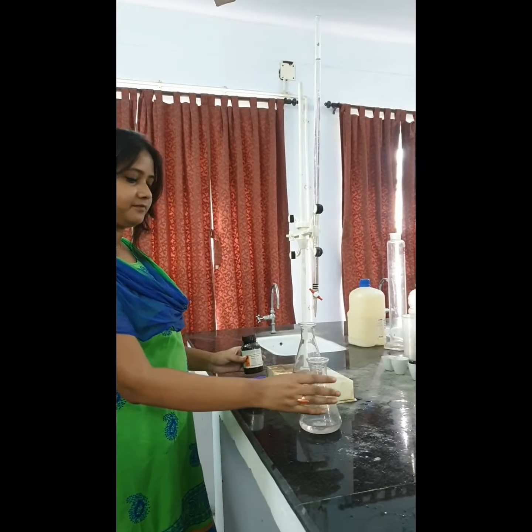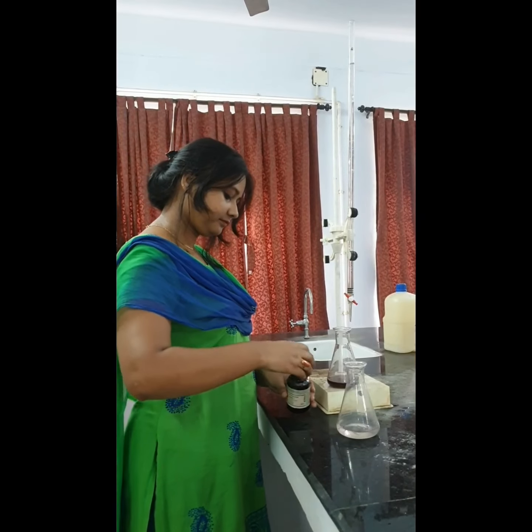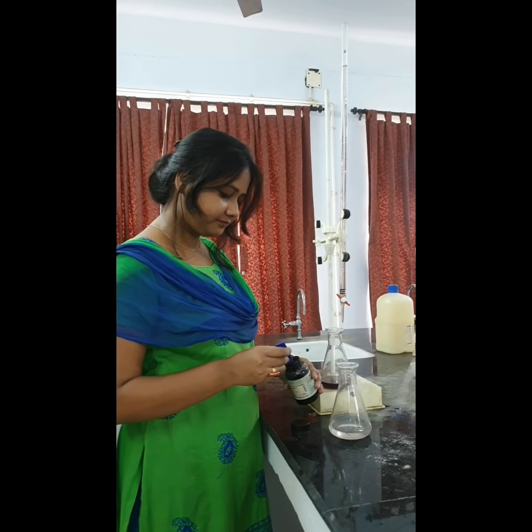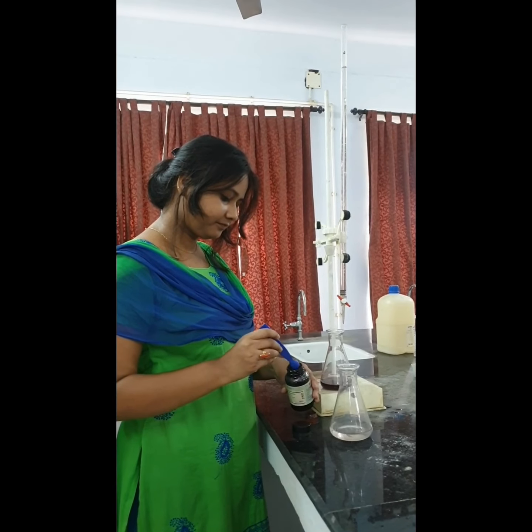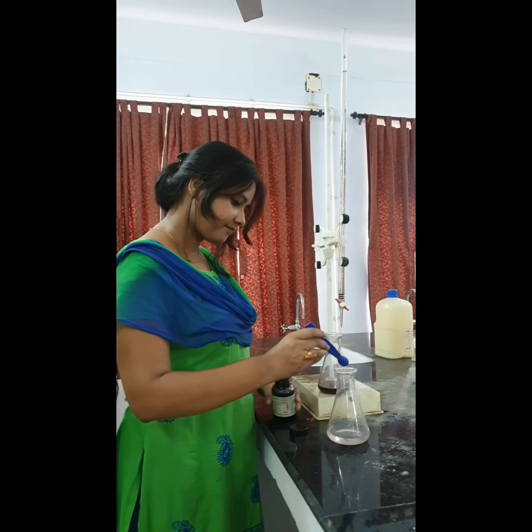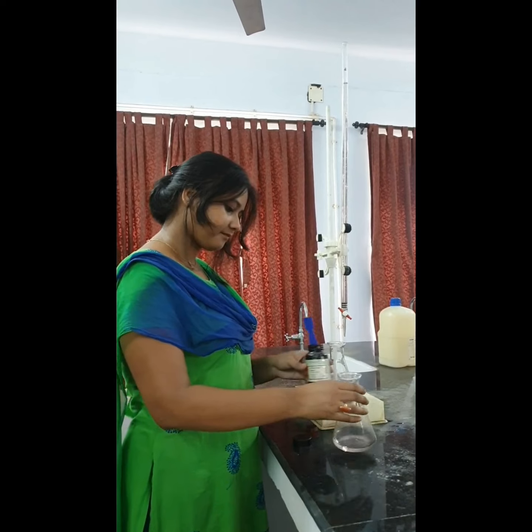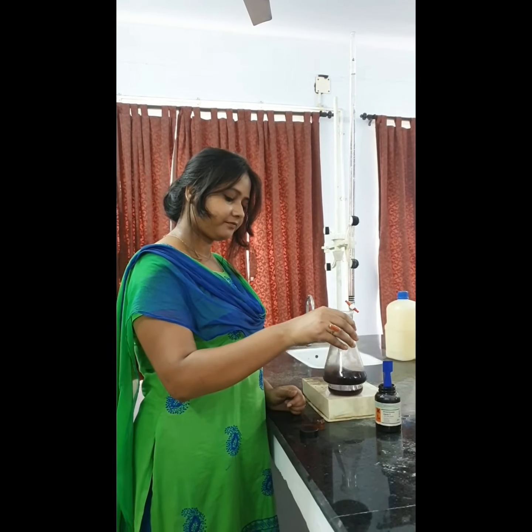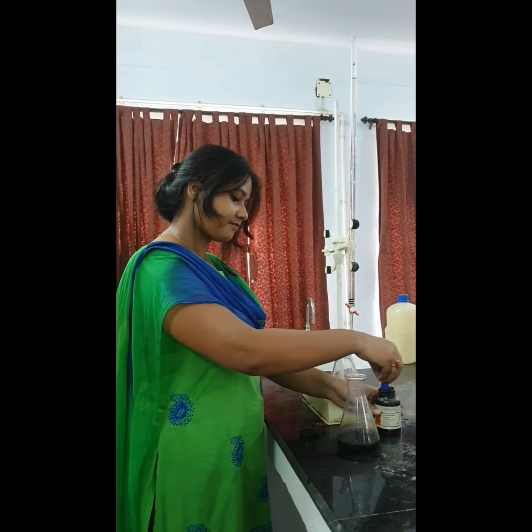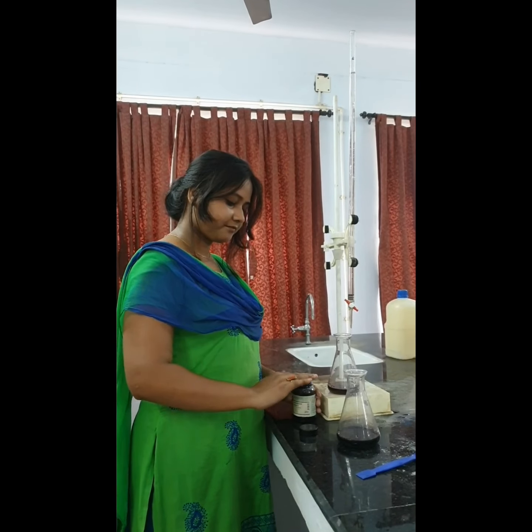We will take a similar amount of distilled water in another flask, and we will add a pinch of Eriochrome Black T indicator. The sample inside the flask is distilled water, and a pinch of Eriochrome Black T is being added into it. This will work as a blank. Blank is actually used in every titration test to make it more accurate, to calibrate it. Again wine red color has been developed in the distilled water also. This is the blank. Please remember, when I use the term blank, it means the distilled water with Eriochrome Black T indicator here, and other indicators in case of other experiments.